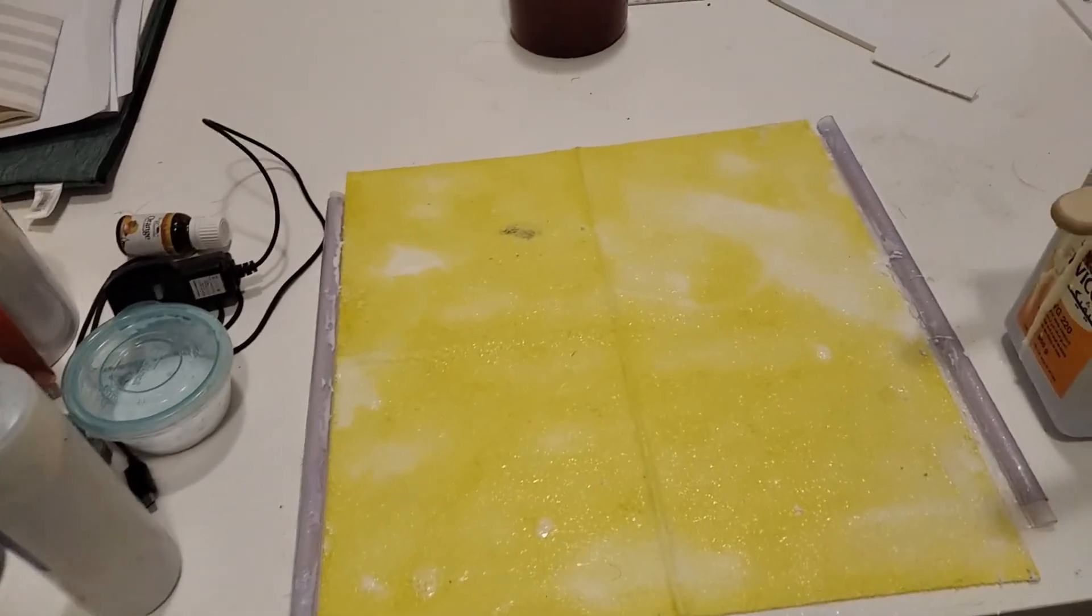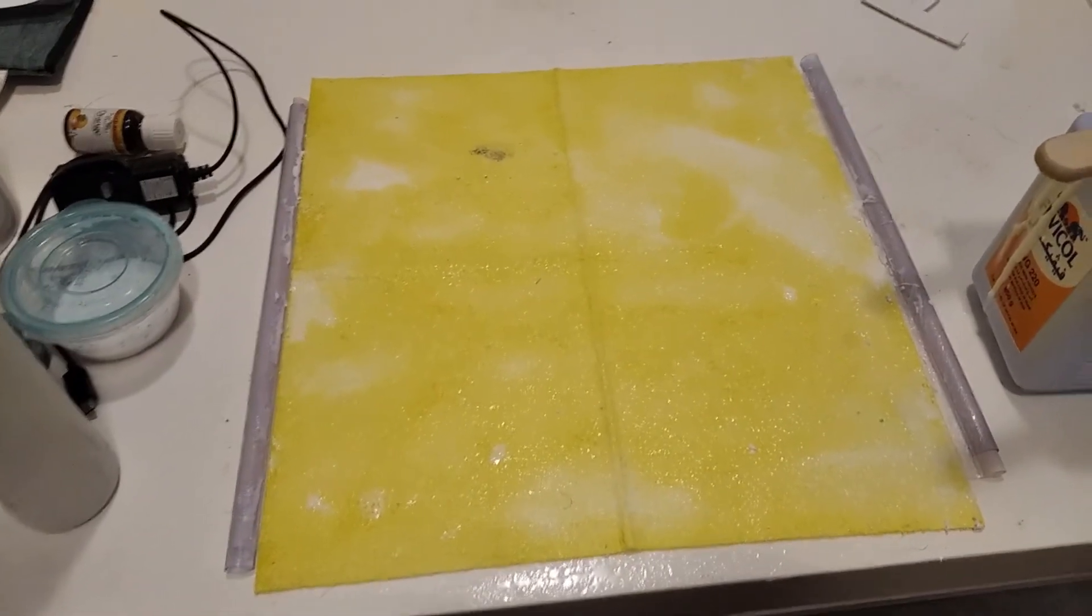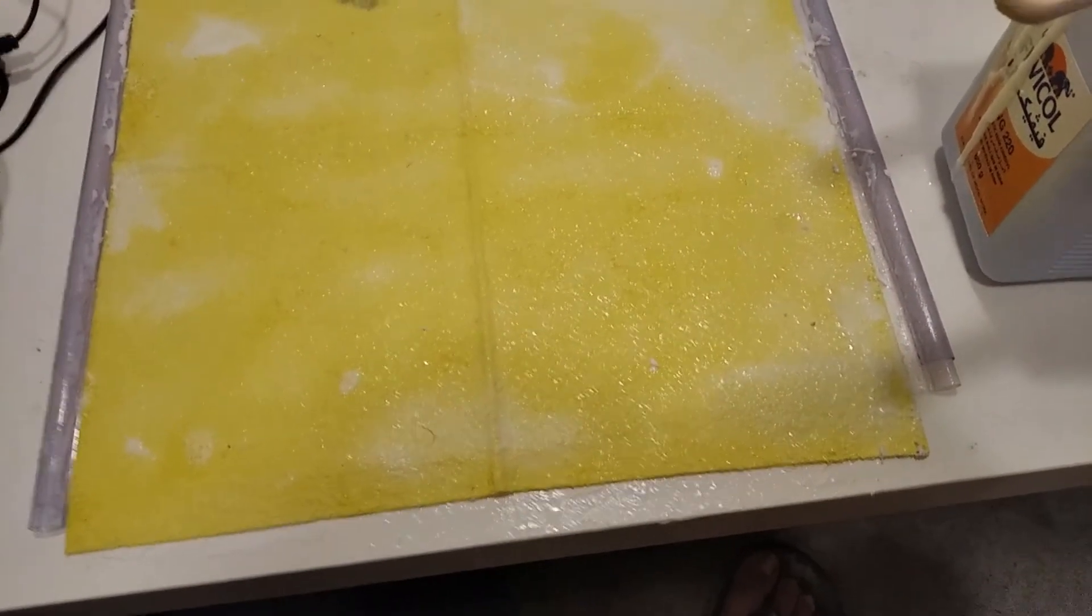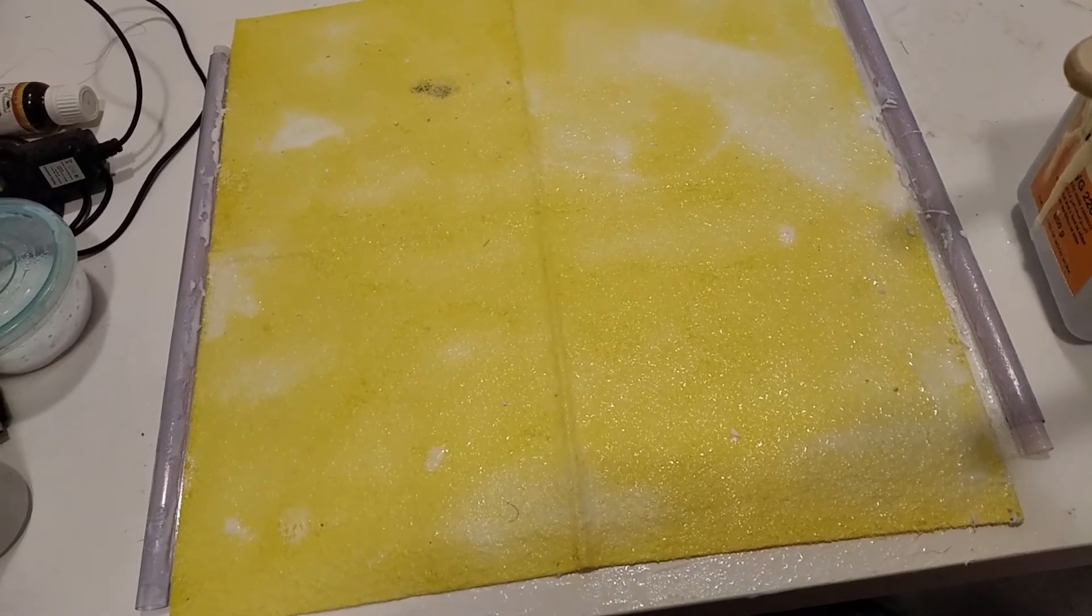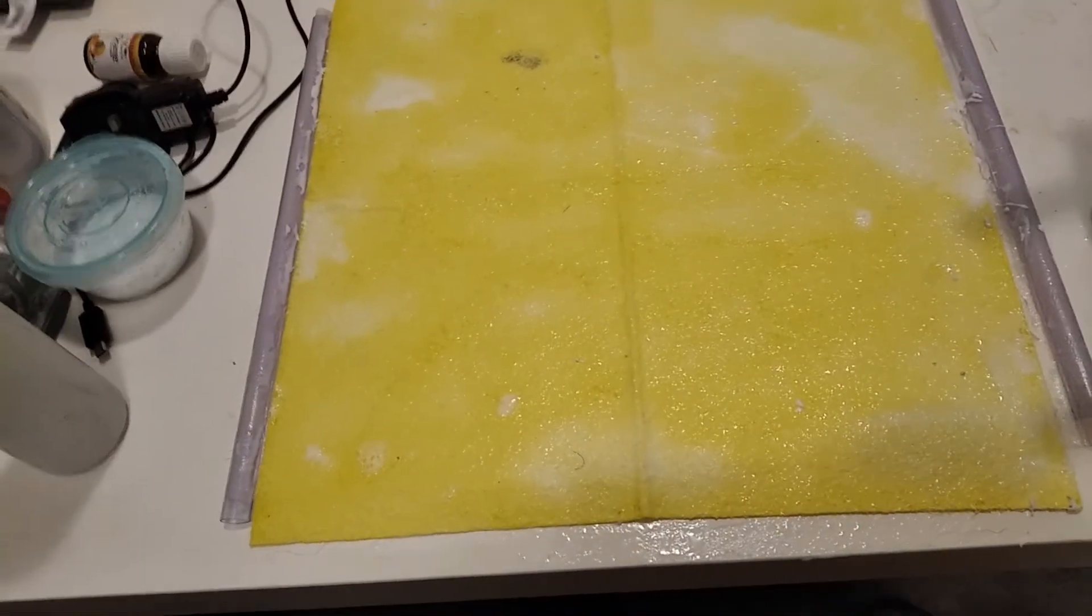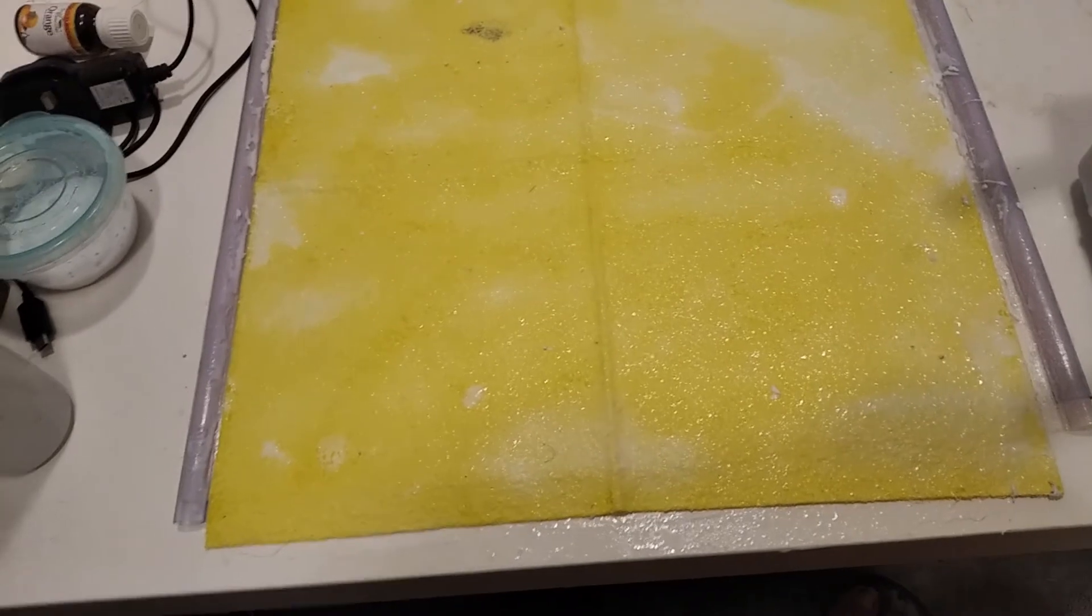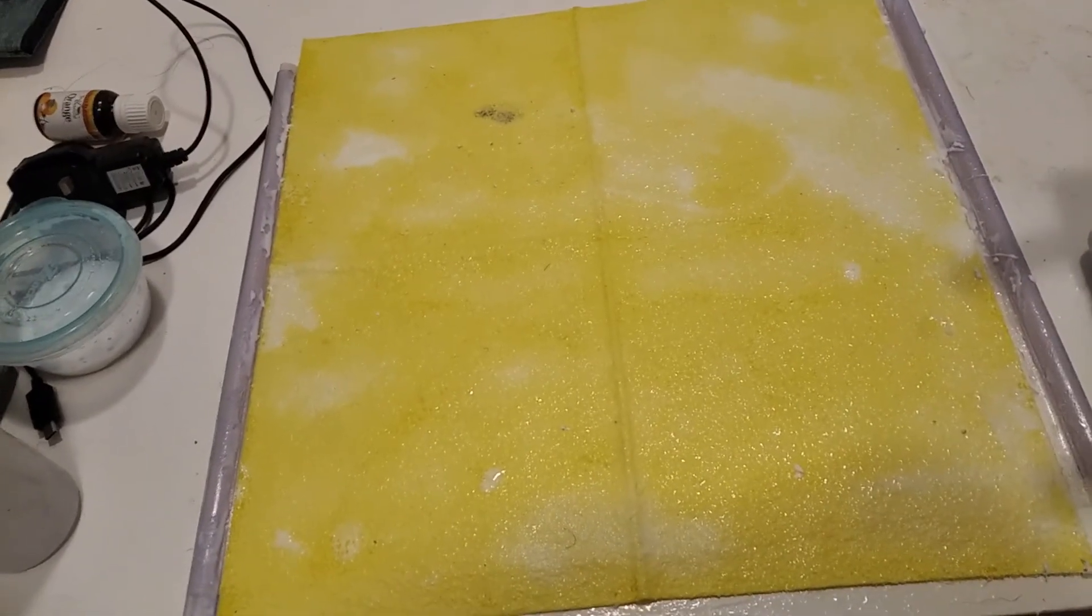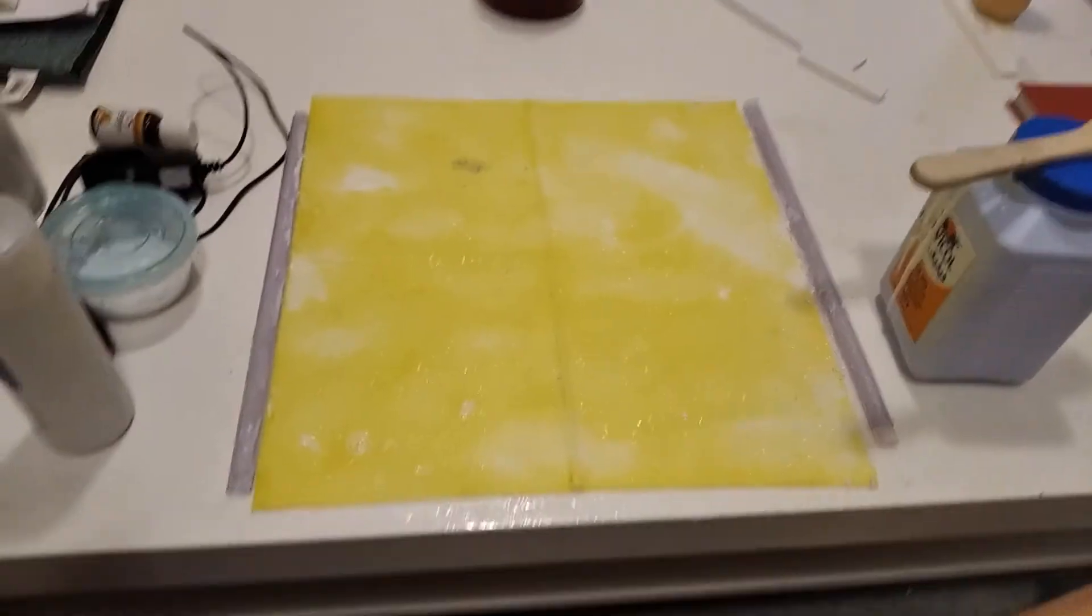The drying process allows the curing to actually finish. Like when you're making a slime, the curing process doesn't actually completely finish - it's still semi-pliable. Once it finishes, this thing is going to become stiff and will remain mostly stiff unless it absorbs a certain amount of water.